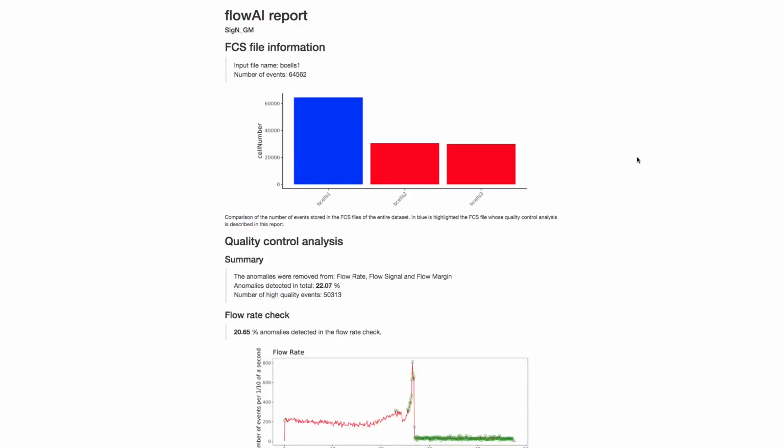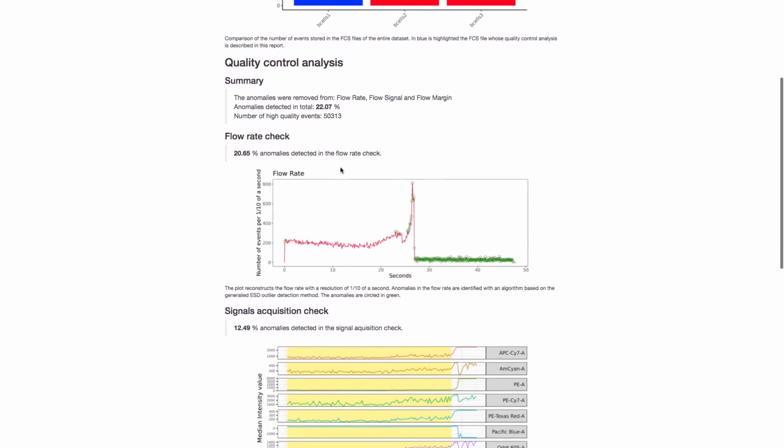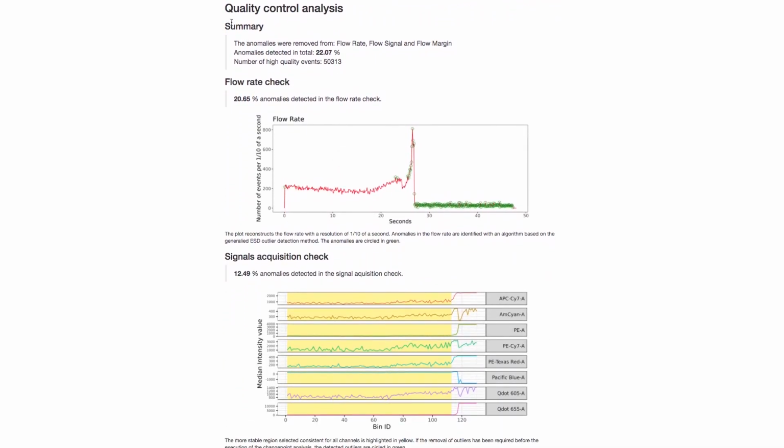Okay, so we've opened up our Flow AI report just for the B cells 1 file, which is the first file in the analysis. We can see at the very top of the report, we're getting information about this file, and we're also getting information about the file in context of the others in the analysis. So we know that we included 3 files in this analysis, and we can see them all represented here. We know which file this report is dedicated to based on this blue colored bar here in this graph. The next thing that we can turn our attention to in this report is a basic summary of which anomaly detections were used, how many anomalies were removed from the file, and how many events that left us with.